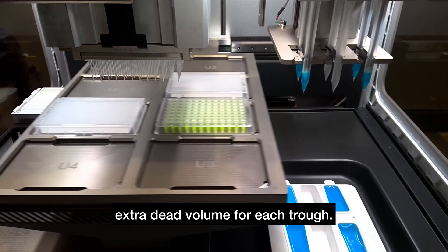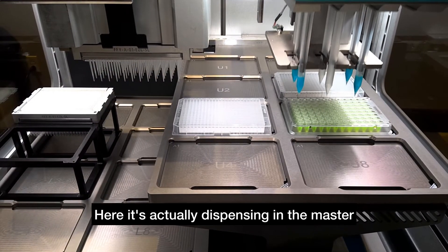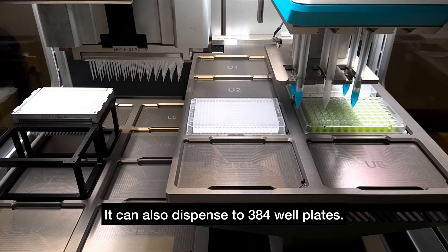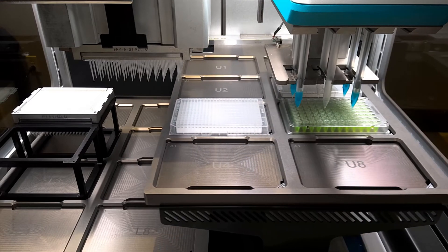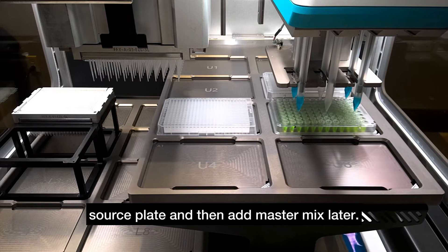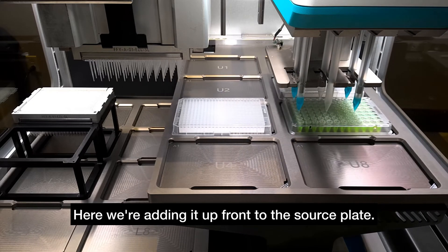Here it's dispensing the master mix to the 96 source plate. It can also dispense to the 384 well plates, so you could transfer a sample from a source plate and then add master mix later. Here we're adding it up front to the source plate.